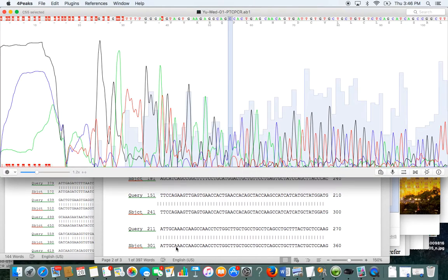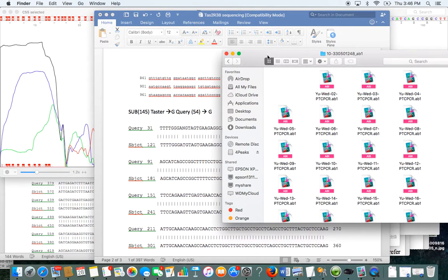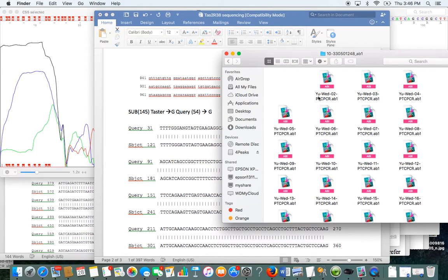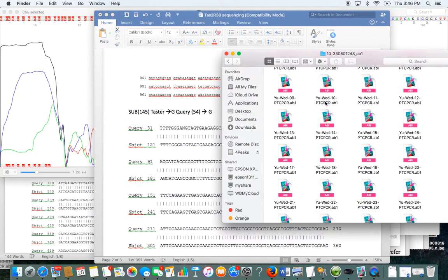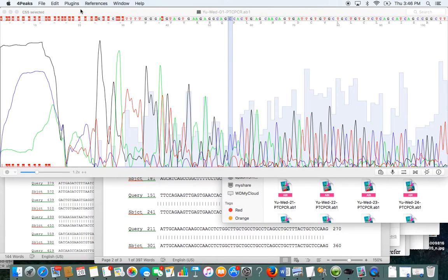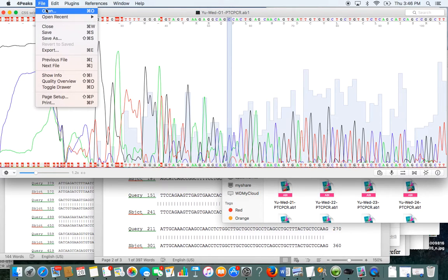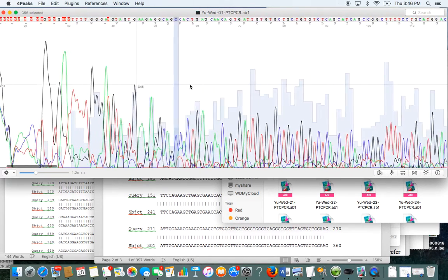You just want to go and upload your AB1 file now. So the sequence files we use for BLAST, and the AB1 files we use for the Chromas or for the 4peaks. You want to go ahead and open it, and they're numbered the same way as the sequence files, just the AB1 files. Then you want to open it in the program you're going to be using. So just File, Open, and you'll get something like this.